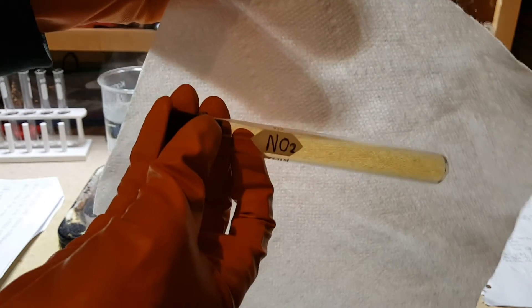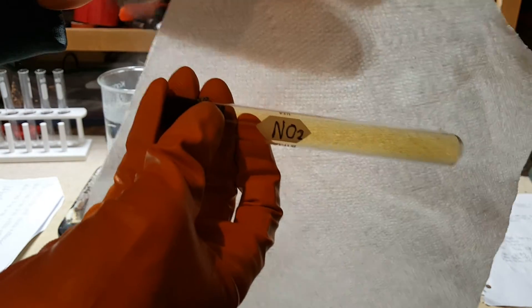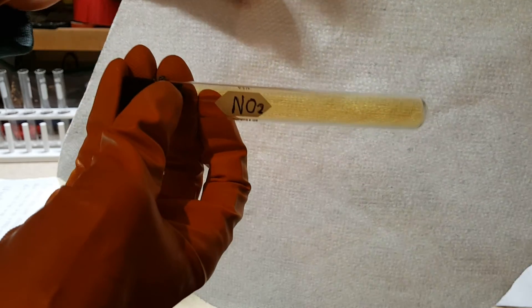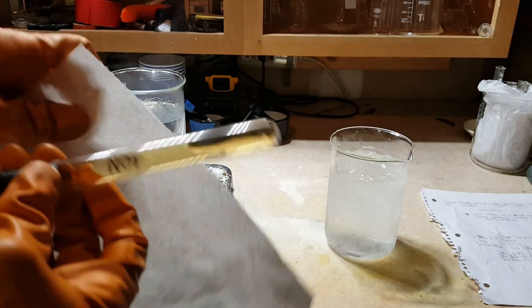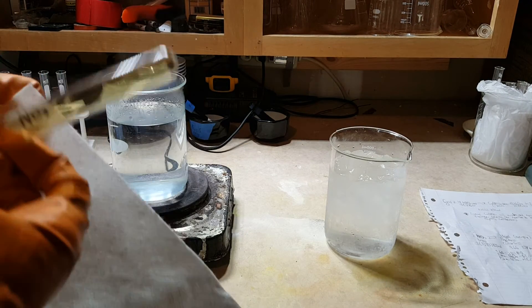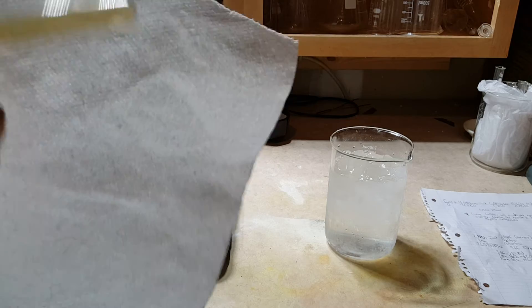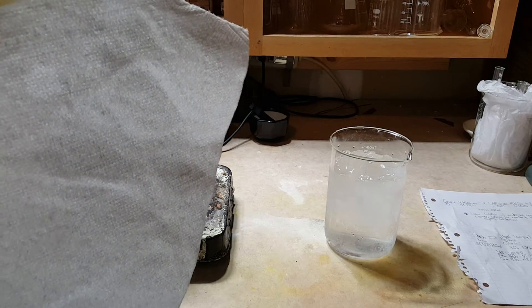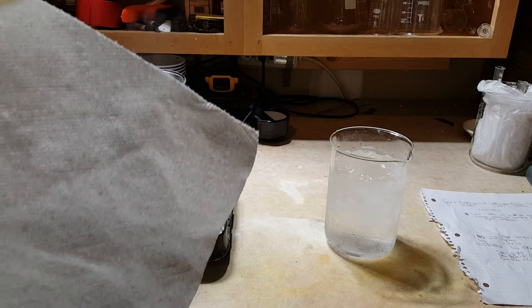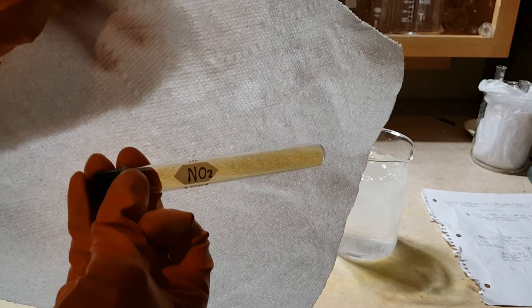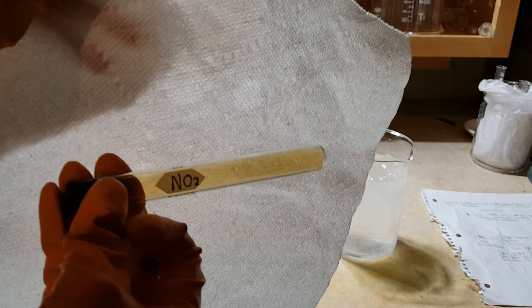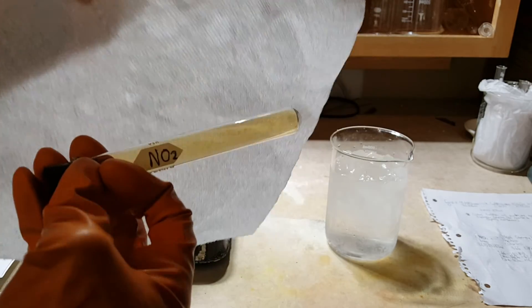So here's my gas sample again. It appears that nothing at all is happening here, but actually the concentration of the two gases here is constant. However, this just means that nitrogen dioxide is combining to form dinitrogen tetraoxide at the same rate that dinitrogen tetraoxide is breaking apart to form nitrogen dioxide. So right now this test tube is just a little bit below room temperature.